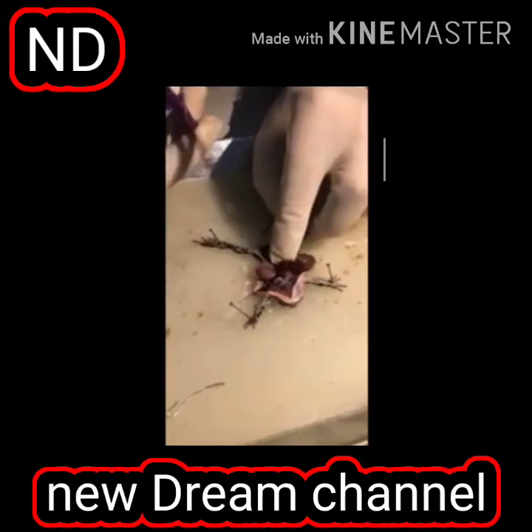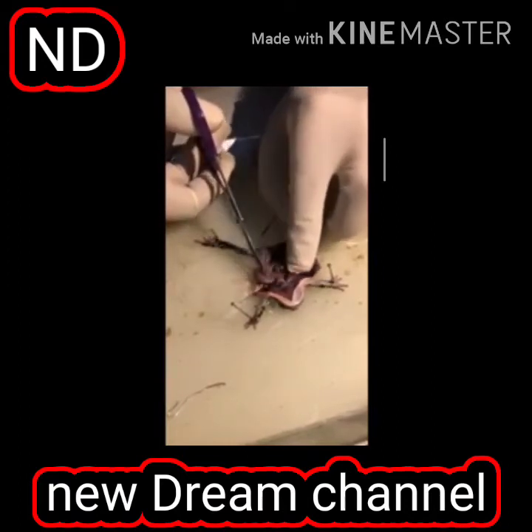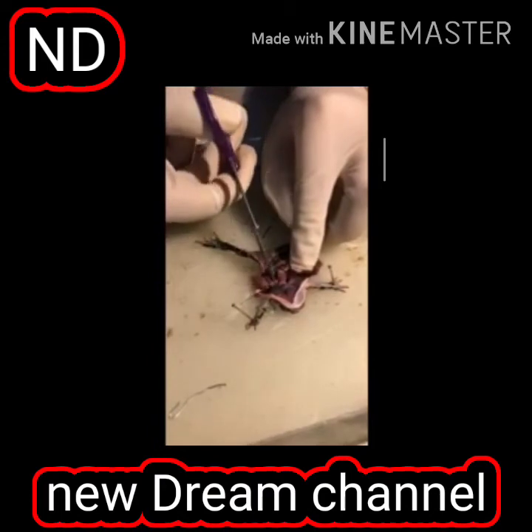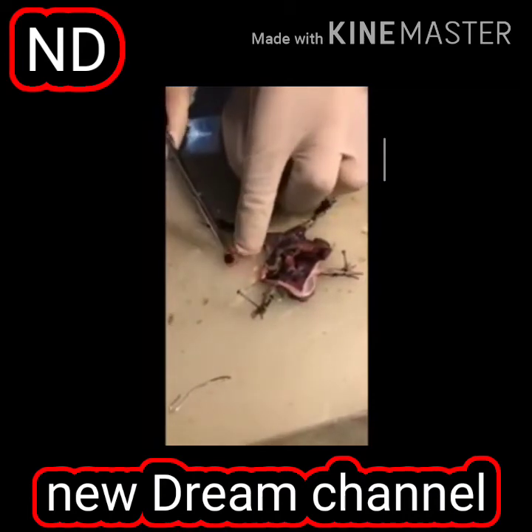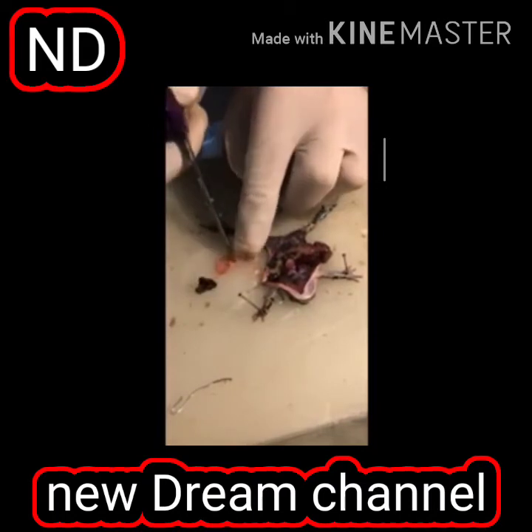This is the small intestine. And then it joins. This is for you. I can cut it for you. It's a stomach. It may be filled with some material. I have taken it. That means it has eaten.